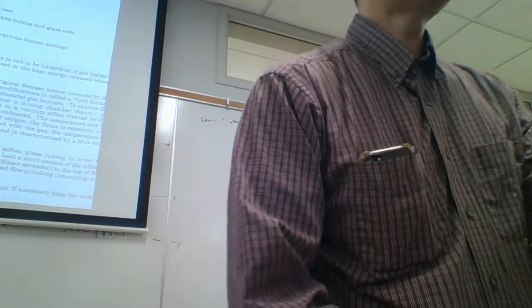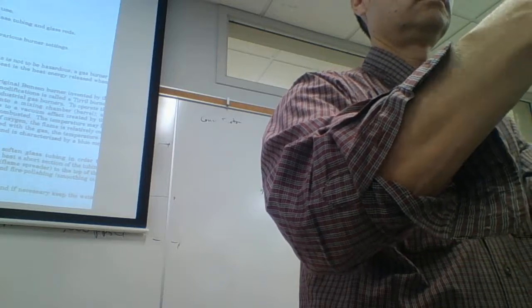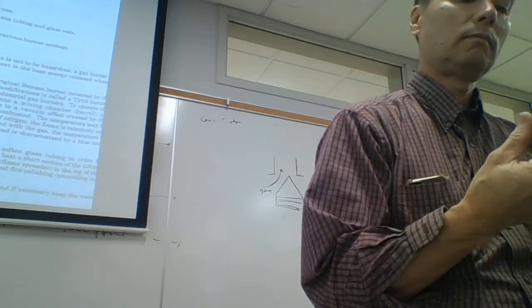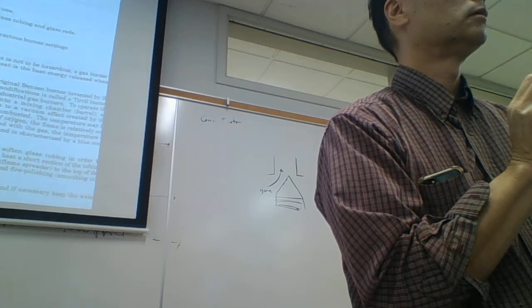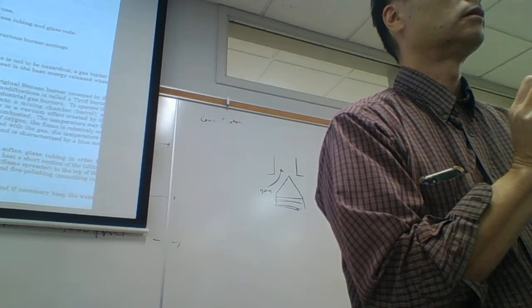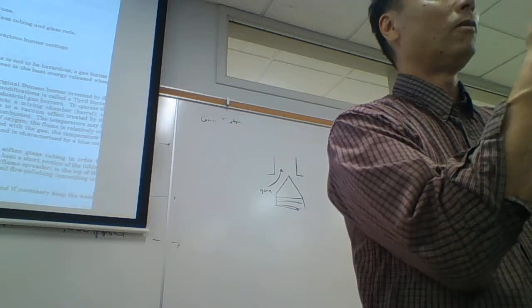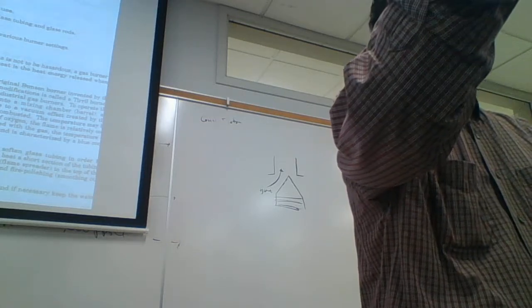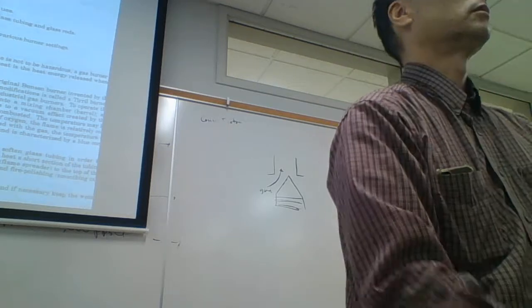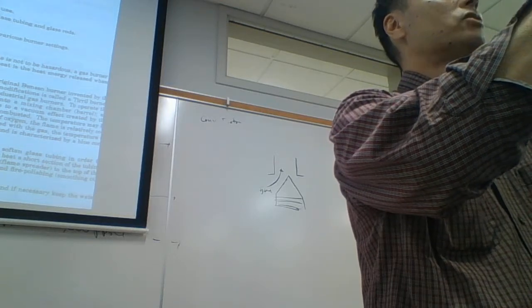Then we got to mix the methane with the air. And you could take the top part. Let's unscrew the top part out. Okay, did you take the top part out? Take it off completely. Now look at the little hole coming from the base. You see the little... Yeah, keep unscrewing. Unscrew the... This is called the barrel. Completely unscrew the barrel off. Okay, now take a little look at the hole in the base. Do you see that hole?